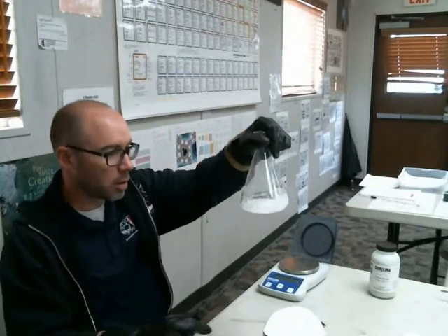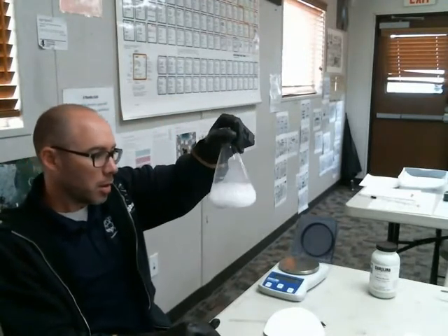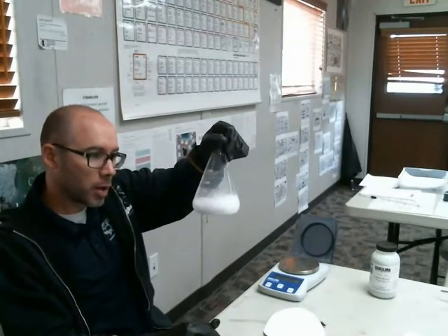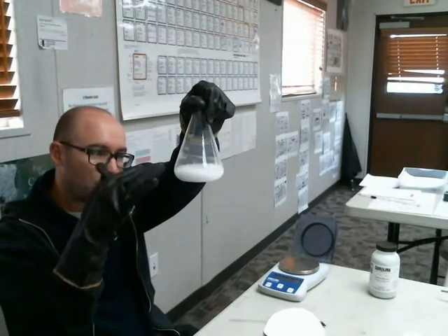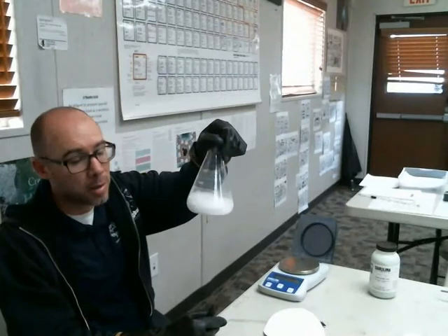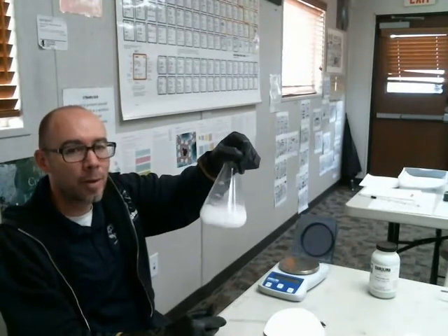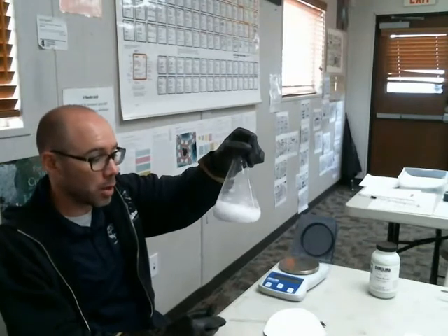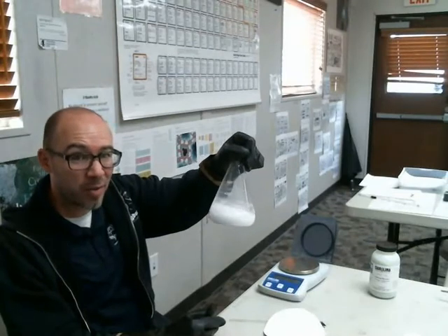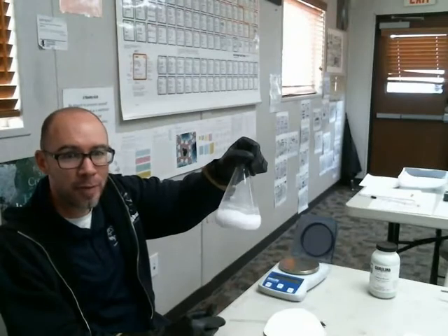All right. So I'm going to start the dissolving process. I want to get most of it to kind of do its thing here before I pour more water. It might be that this won't all dissolve with the amount of water that I got in here, but now I've got all of this solute in here, and I just need to add enough water to make 500 milliliters of this half molar solution, right? So if I had a full liter of water, I'd have half a mole. I only have half a liter of water, so I need half of that.